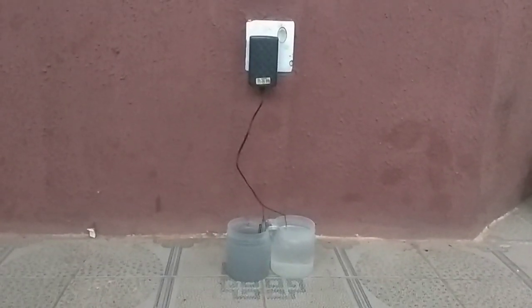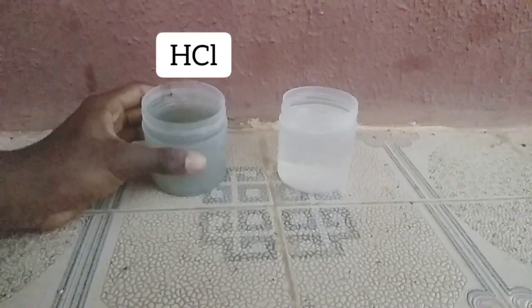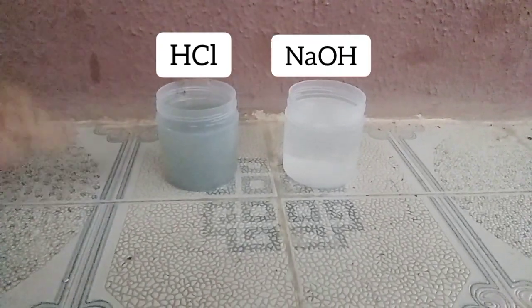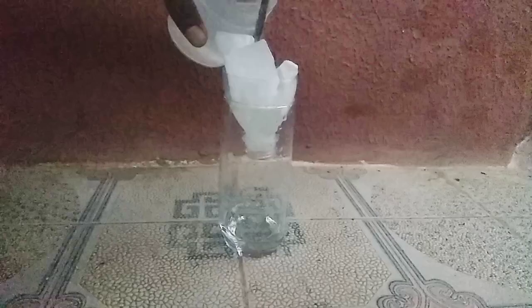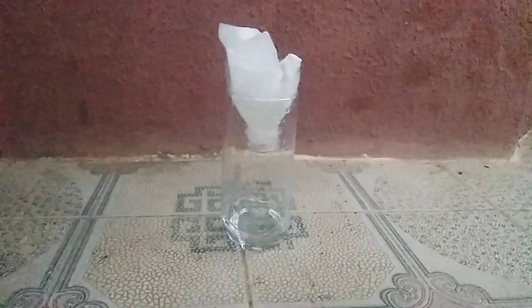I've given this reaction about seven days, so I'll disassemble it. This is my hydrochloric acid and this is my sodium hydroxide. As you can see, they are very impure and they need filtering. I'm going to filter my sodium hydroxide first. It took some time, so while it's filtering, I'd like us to see the solution to the question I gave earlier.